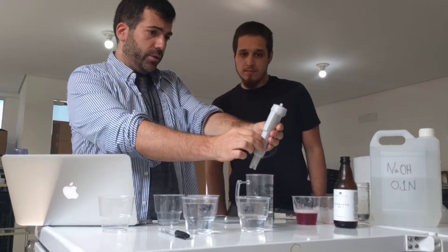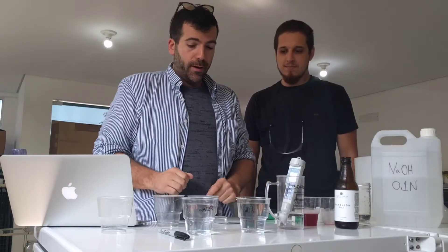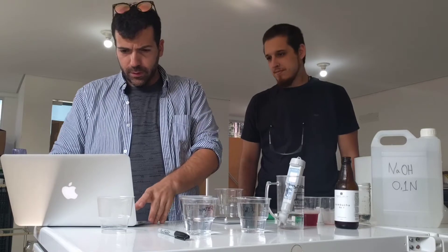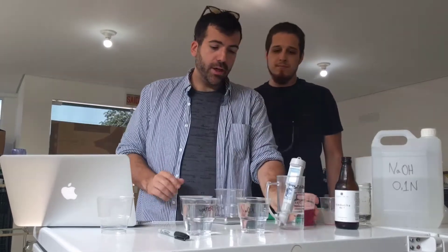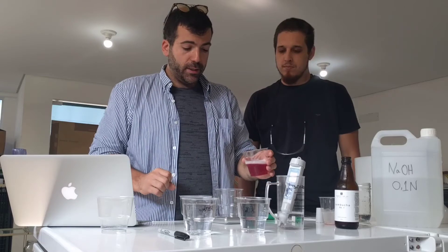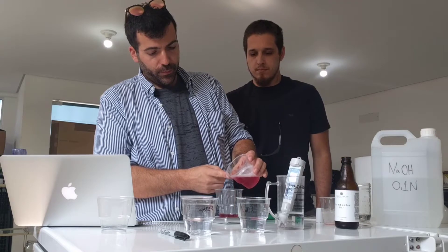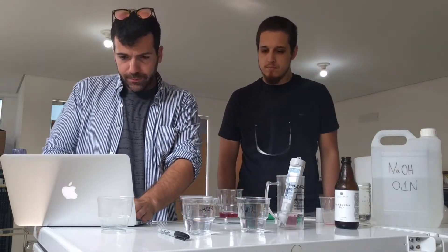We've just calibrated the pH meter. So let's get started. Start with a cup — let's weigh the cup. 4.2 grams. Then we're gonna put in some kombucha. I usually like to put about 20 grams — 20 milliliters of kombucha, which in this case is gonna be more or less 20 grams. Okay, 21.3 grams, so we're gonna write that down as well.